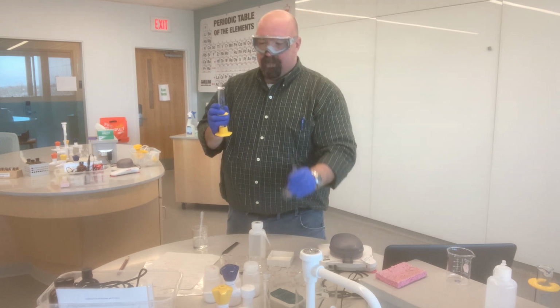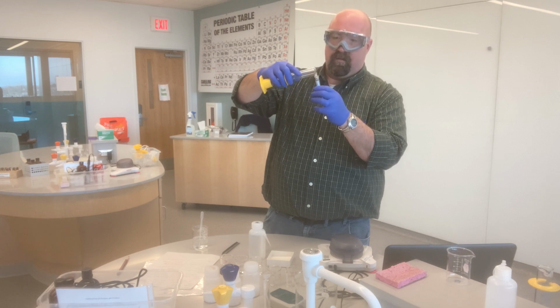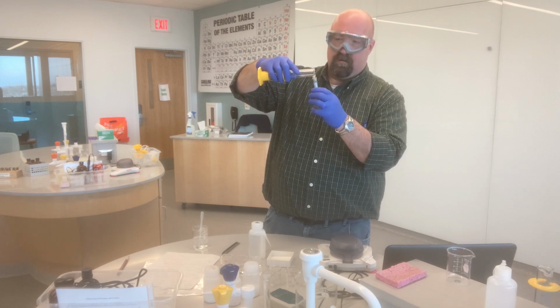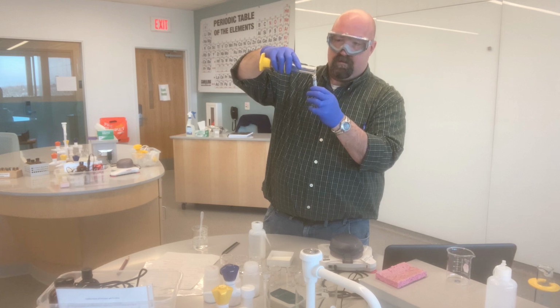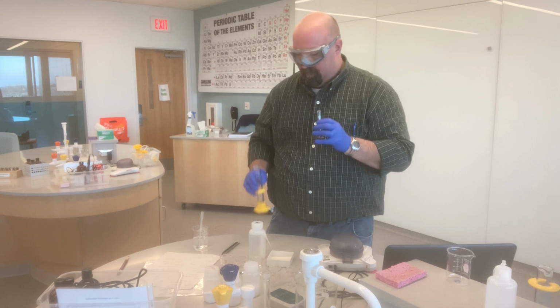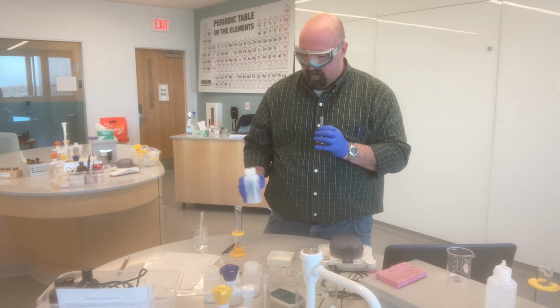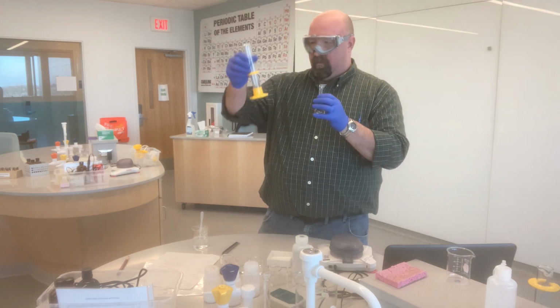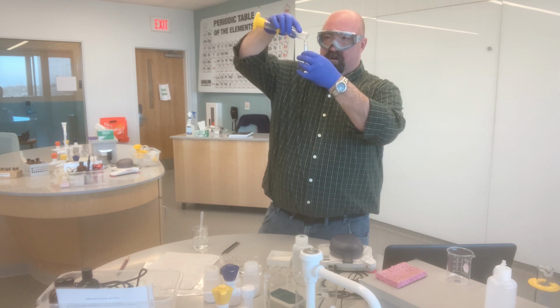Again, I'm looking to make 25 milliliters total, so I'm just going to pour this into my 25 milliliter volumetric flask. Carefully, because this is a small opening in my flask here. If I can do this without spilling it all over the place, I will be impressed. There. And I just want to make sure that I get all of the solution in here, so I'm going to rinse the graduated cylinder with a little bit of water, and then pour that in, just to make sure that I got all of that initial stock solution.